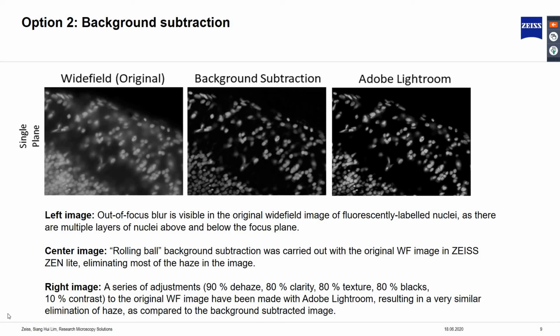Wide field image after background subtraction using the rolling ball algorithm available in Zen software. While on the right, the image was processed with photo editing software from Adobe, using a series of adjustment steps to the original wide field image. The settings used in this image were 90% dehaze, 80% clarity, 80% texture, 80% blacks, and 10% contrast.